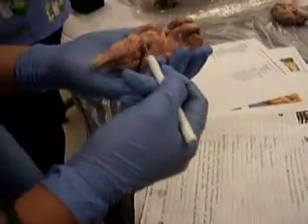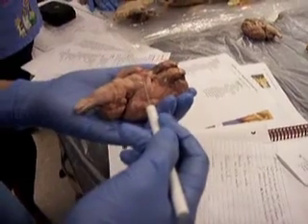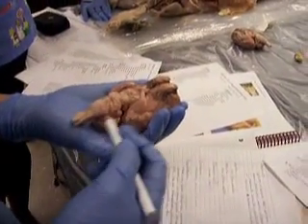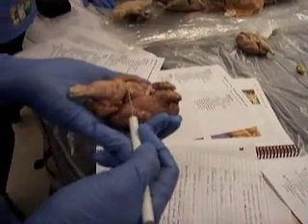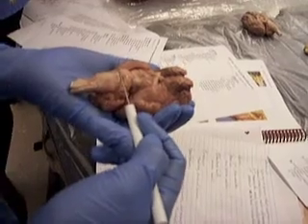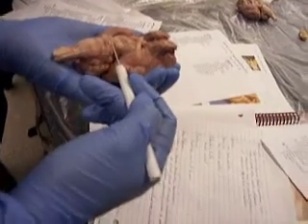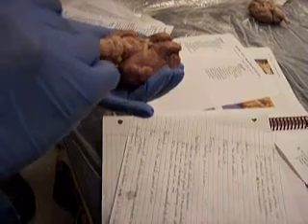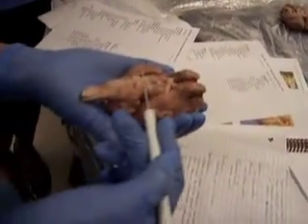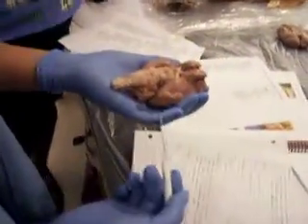Alright, so then the brainstem. This is all part of the brainstem. This is the midbrain, this little section right here. The top part of the brainstem is the pons, this thing that kind of bulges out. Right under the pons is the medulla. And then the extension of the medulla are the pyramids. So pons, medulla, pyramids. The pyramids look like a little triangle. I would just remember them, pons, medulla, pyramids. They're not going to move.